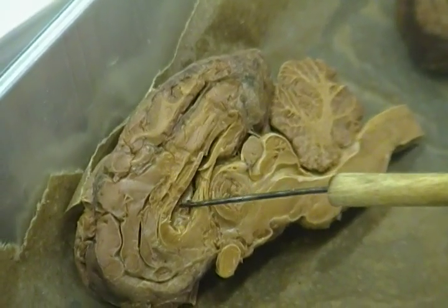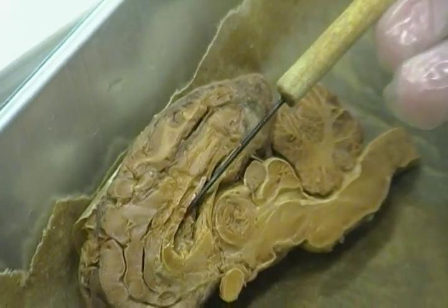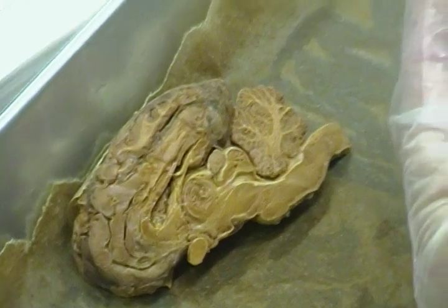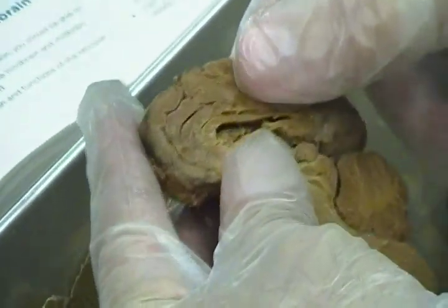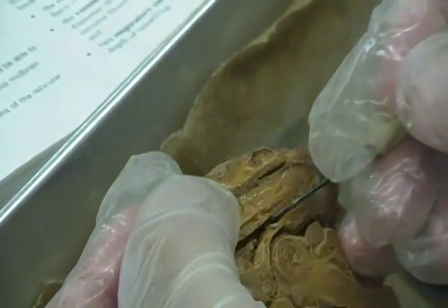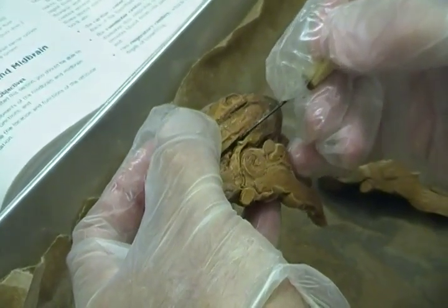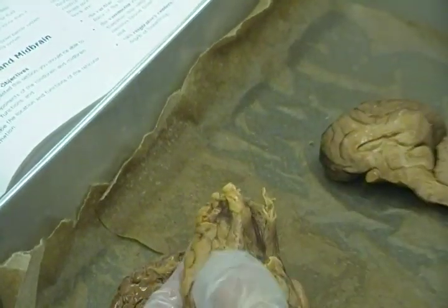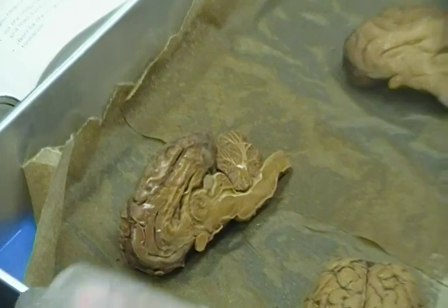There's some spongy-looking stuff on the inside here that's actually tiny blood capillaries. What is it called? Corpus. You're close. Blood capillaries inside the ventricles. Carotid? You're thinking. Produces CSF. I don't see any in here. Choroid plexus from the back. Very good. Okay. So what did I ask you?